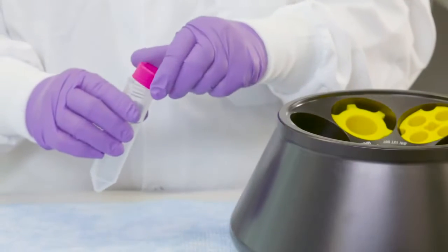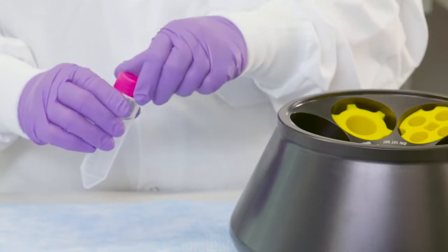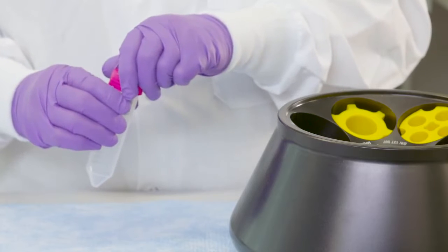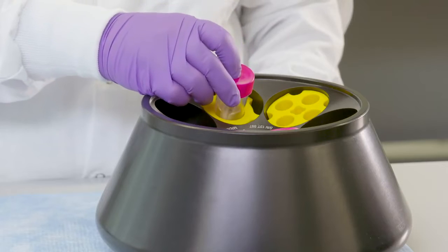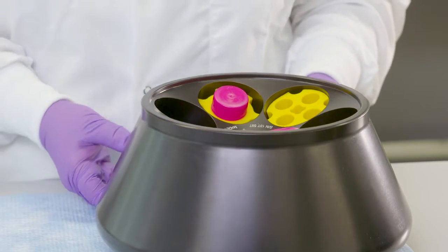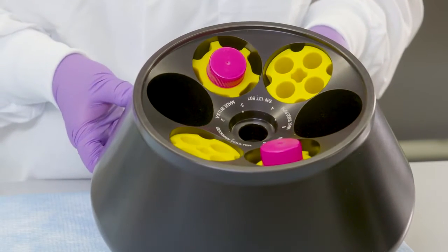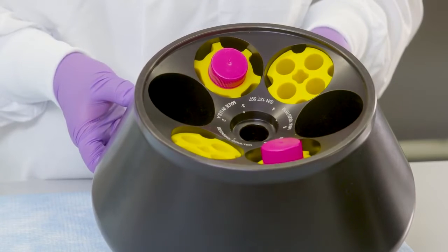The assembled product should be capped at all times during centrifugation to avoid evaporation and sample-to-sample cross-contamination from aerosolization. For samples that require biological or aerosol containment during centrifugation, select appropriate safety rotor cap and insert types accordingly.